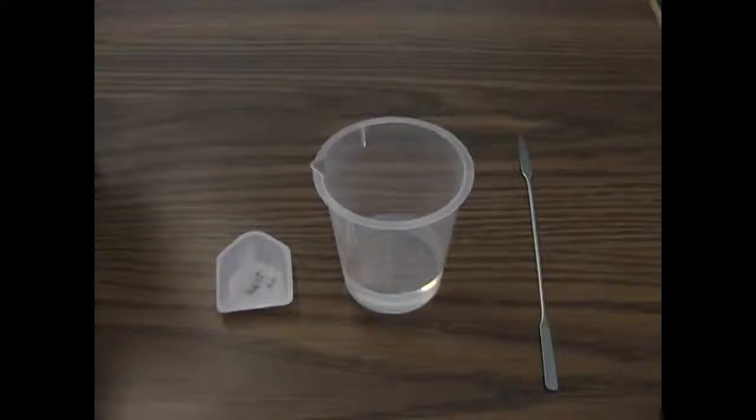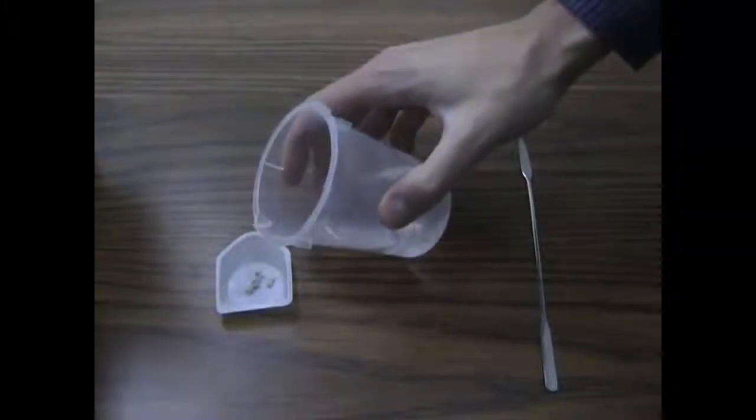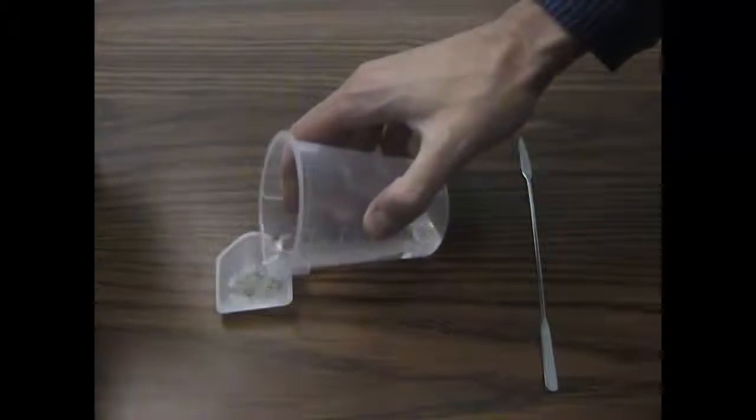In order to ensure dry particles are mixed properly, they should not be added directly to the sample chamber. Instead, they should be mixed into a small amount of water first.